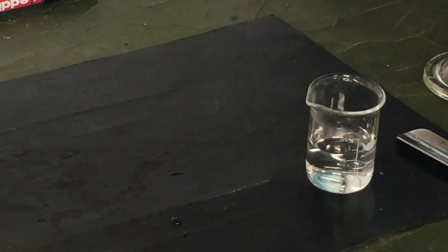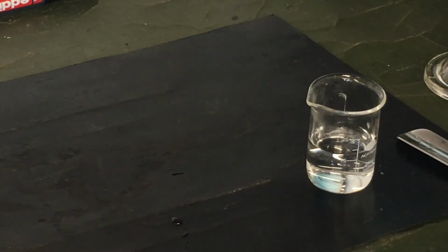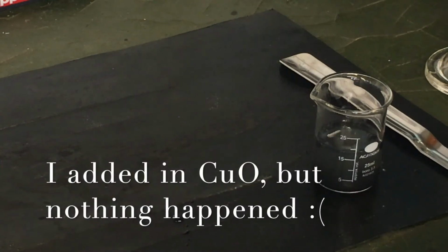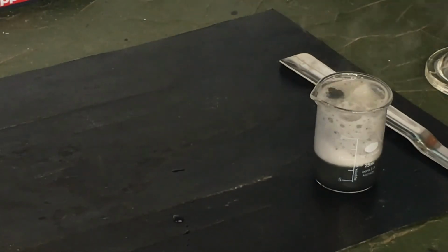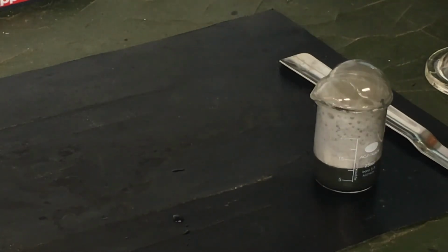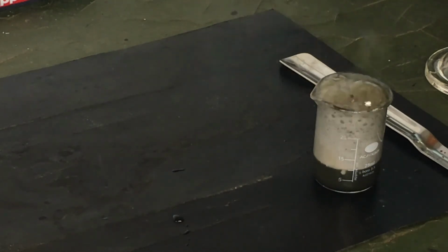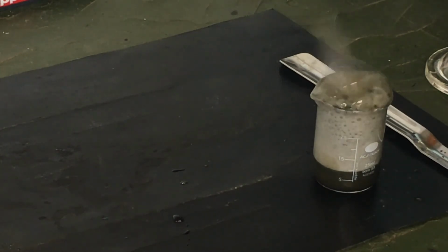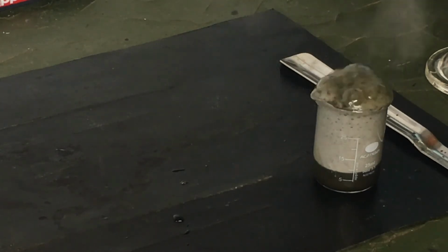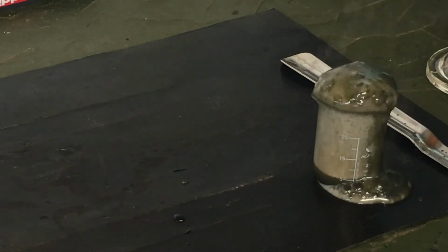I reckon there's quite a lot of hydrogen peroxide still left in there, so I'm going to move on and add in some manganese dioxide, because I know this does something. This is a much slower oxidizing agent than the potassium permanganate, and as mentioned before, it's actually produced in the decomposition of it. For this reason, you should not add potassium permanganate solution directly to hydrogen peroxide. You should add the hydrogen peroxide. Oh, it's spilling over, great.